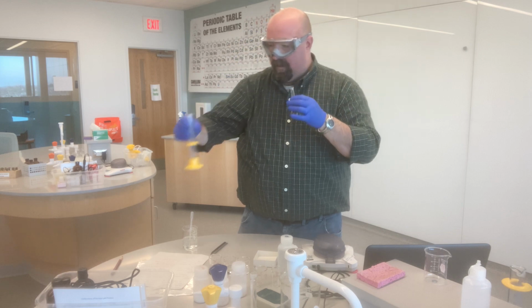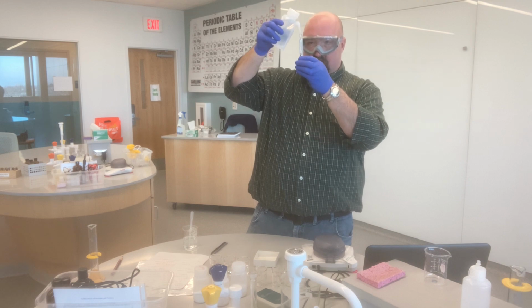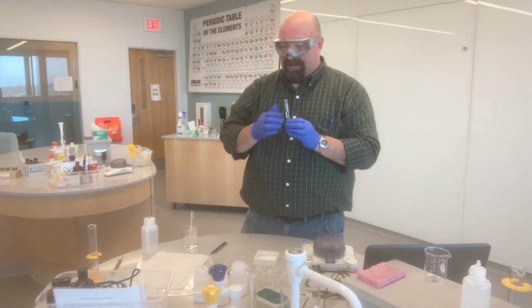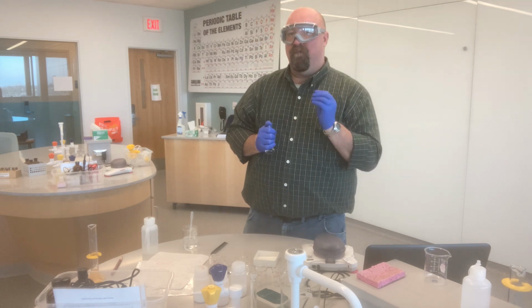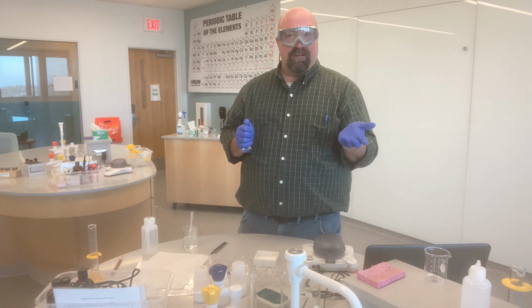I'm still well below my line, so that's good. And now I'm just going to use my squirt bottle and fill up to the line. Here. So again, what I did is I took 20 milliliters of the 0.025 molar NH4NO3 and I diluted that up to 25 milliliters.